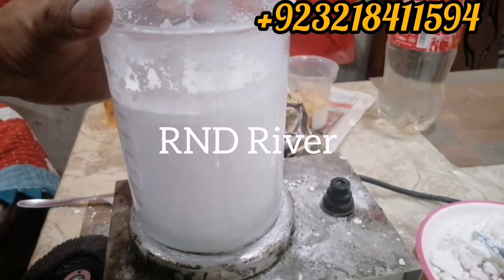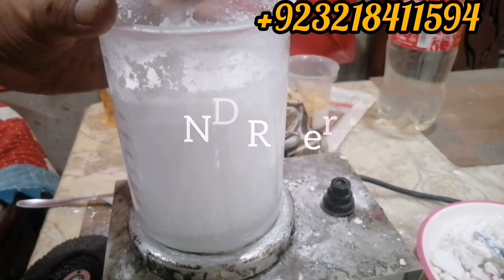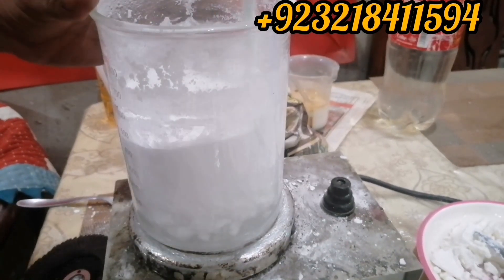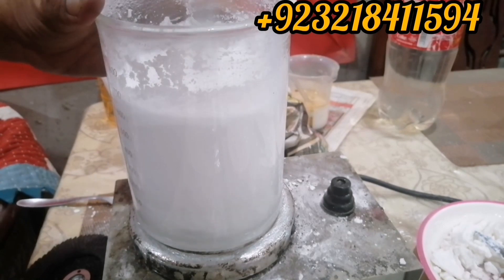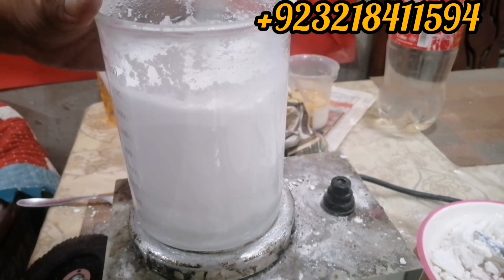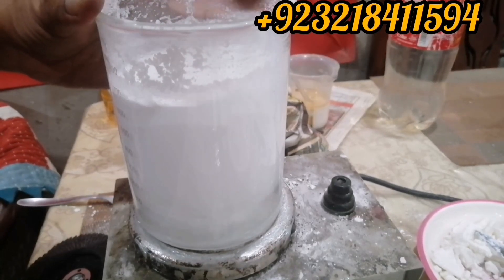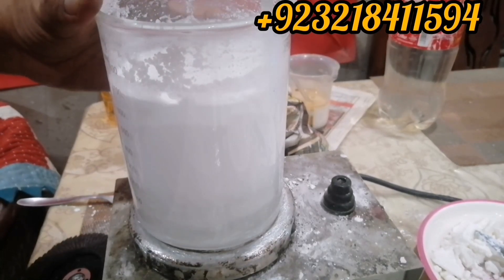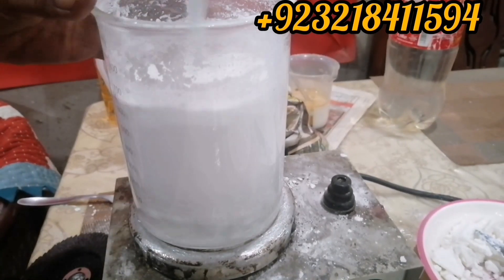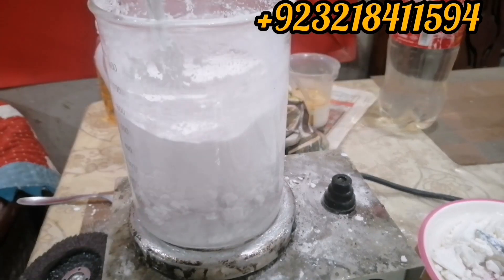Look at the bottom of the beaker — separation of water is happening very quickly because the sodium stearate reaction has been completed. But we still have to remove all the water by temperature. As the heat process continues, the remaining water will be removed by heat.